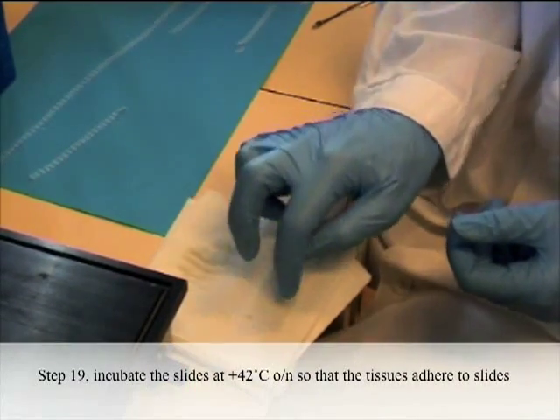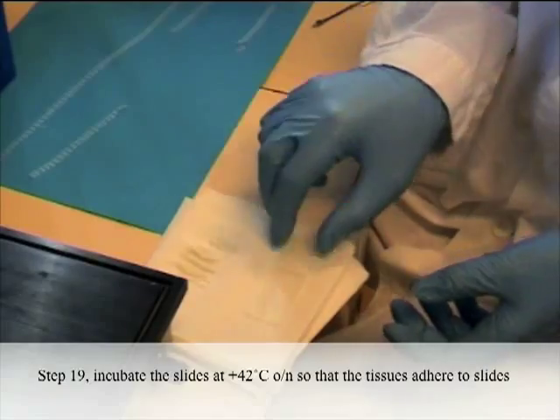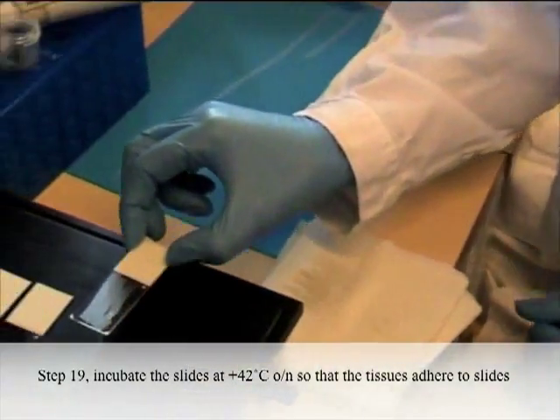Step 19: Incubate the slides at 42 degrees centigrade overnight so that the tissues adhere to the slides.